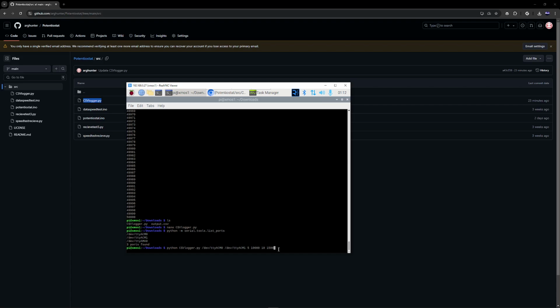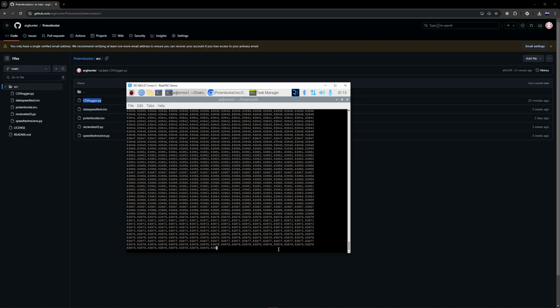Now, to stay in accordance with Nyquist's sampling theorem, make sure you have a sampling rate that is at least twice the frequency. Now, if we run this, you can see it begins reading data from the Teensy. And after that's done, it gets saved to output.csv. Now, I can show you the result of a previous run.